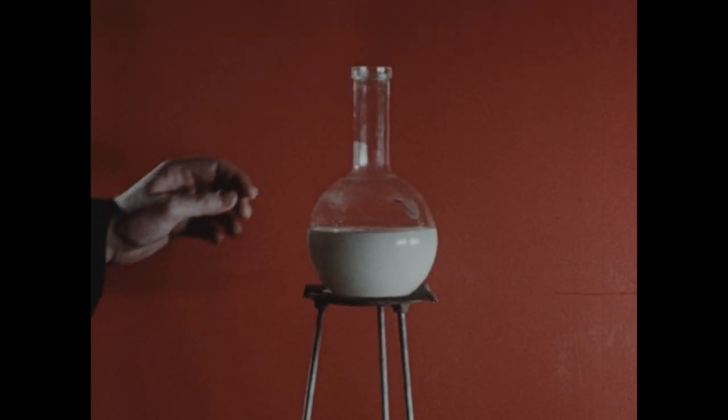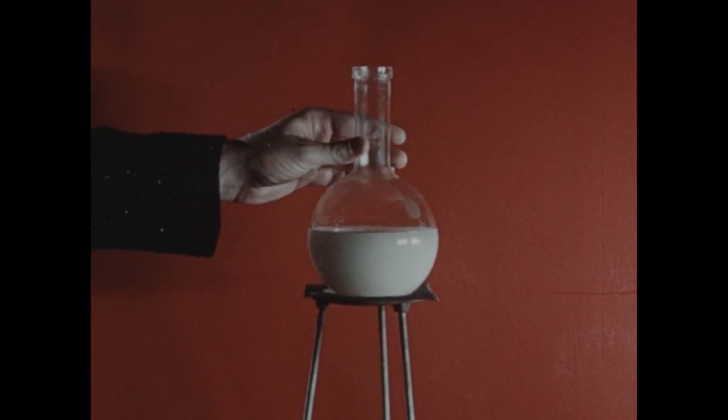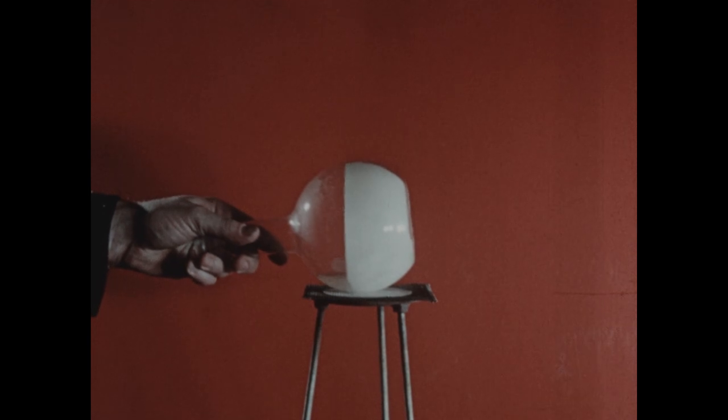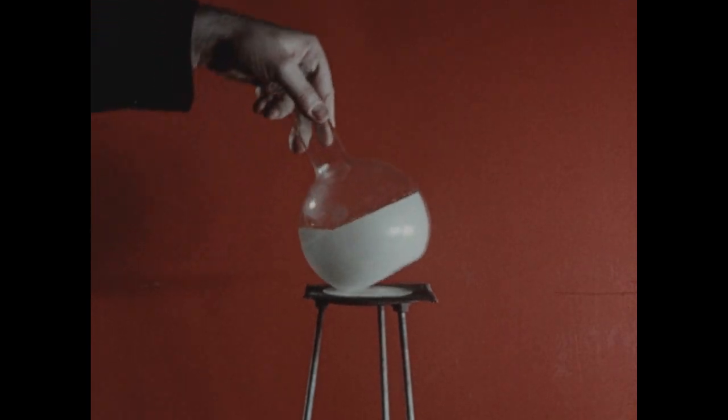So much of the sodium acetate crystallized from the solution that there's scarcely any liquid phase left, as we can illustrate by tipping the flask over. You can see a very small quantity of liquid leaking out of the crystals here. The rest of this large mass of material is solid sodium acetate, which was present in the original solution in a supersaturated condition.